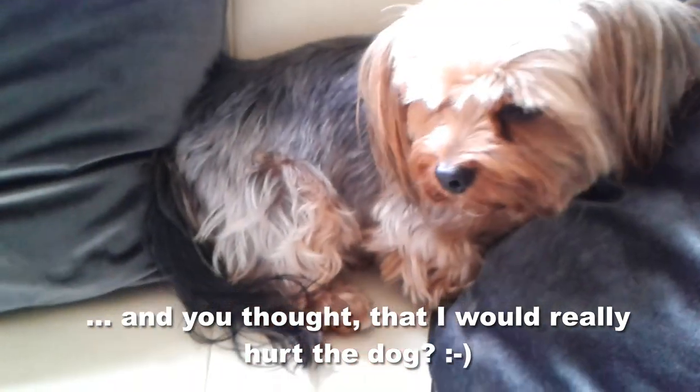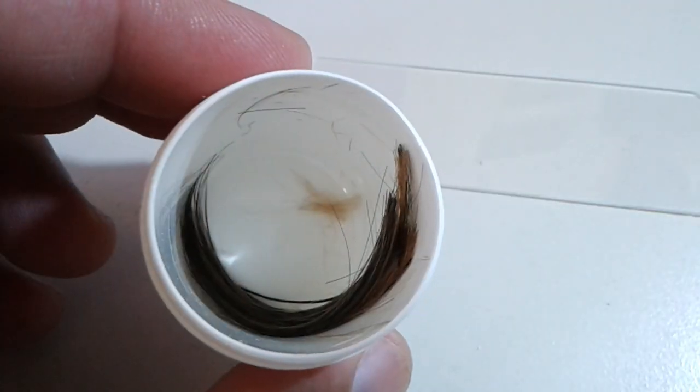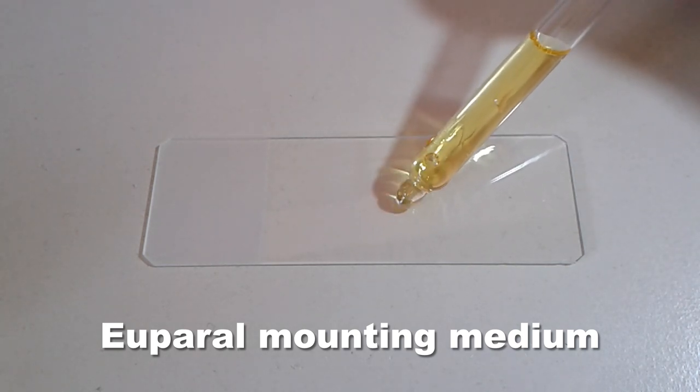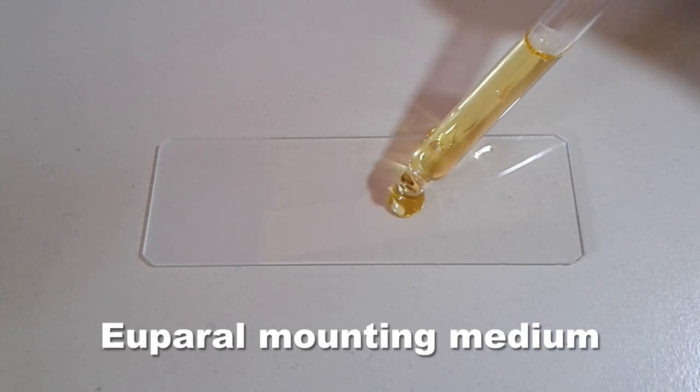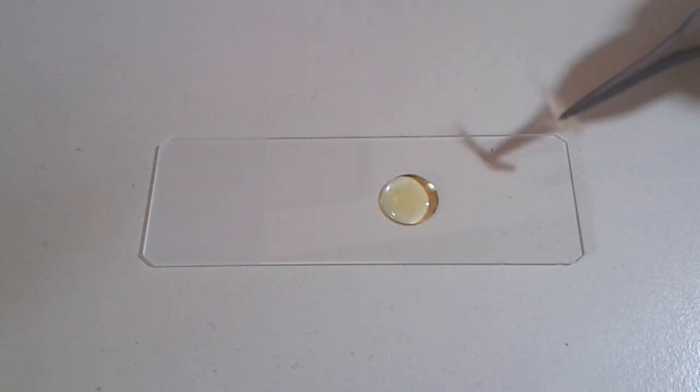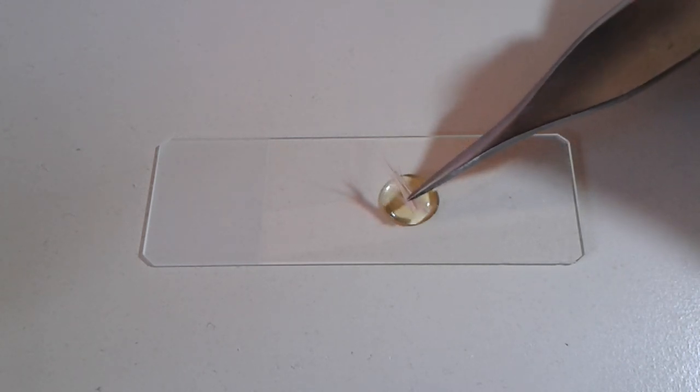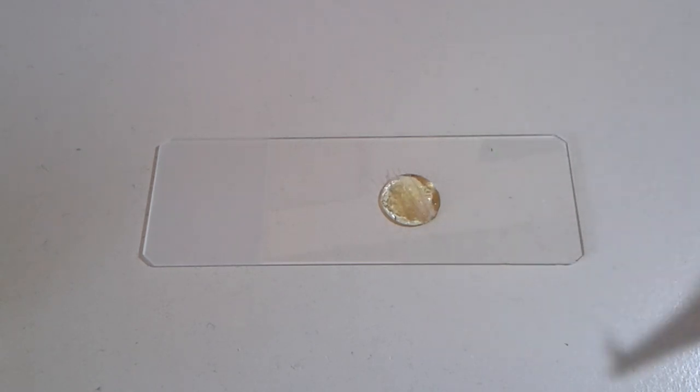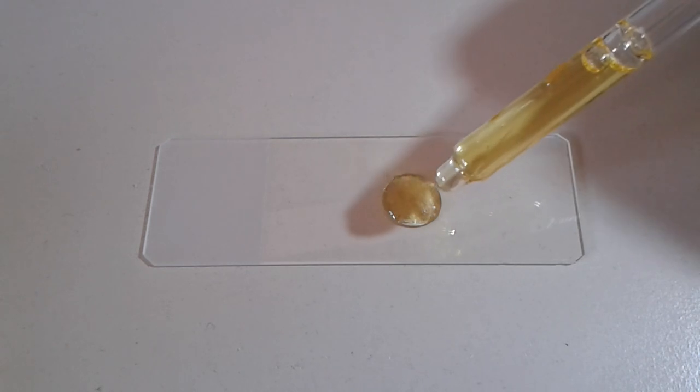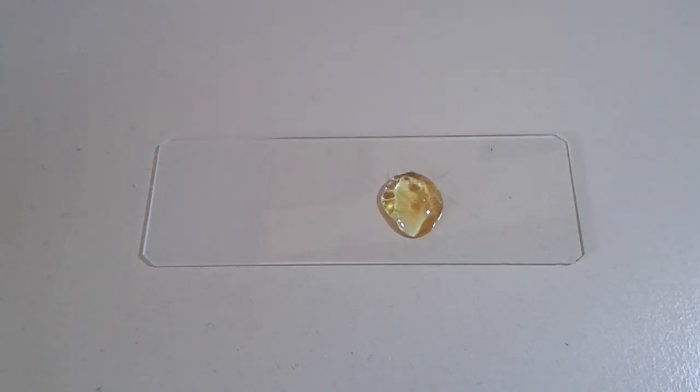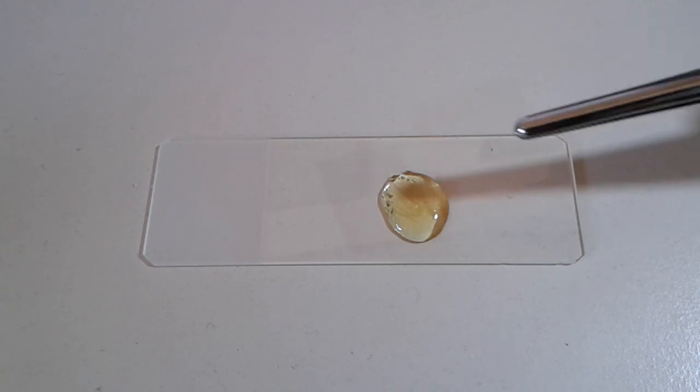So it's protein fibers that I'm going to be looking at right now. These protein fibers are hydrophobic because they're covered a little bit with animal fat and therefore a hydrophobic mounting medium is also very suitable because then there are fewer bubbles. So I'm placing now on the microscope slide some of this mounting medium. It happens to be Euparal, that's the name of the medium. And then into this mounting medium I'm putting the part of the dog. I'm using my tweezers now and in order to minimize the bubbles I'm pressing the fibers, the protein fibers into the mounting medium. And as a matter of fact, I'm also adding a second drop of mounting medium on top just to make sure that everything's really nicely covered.